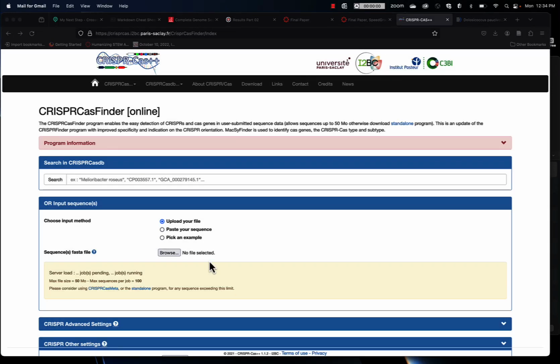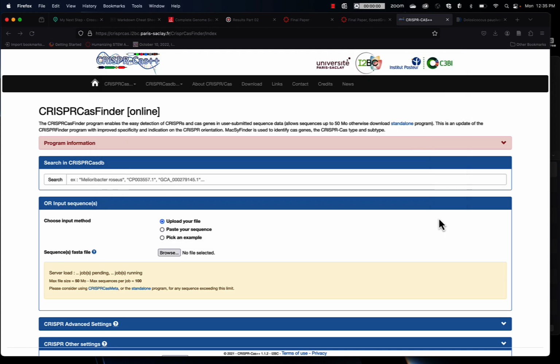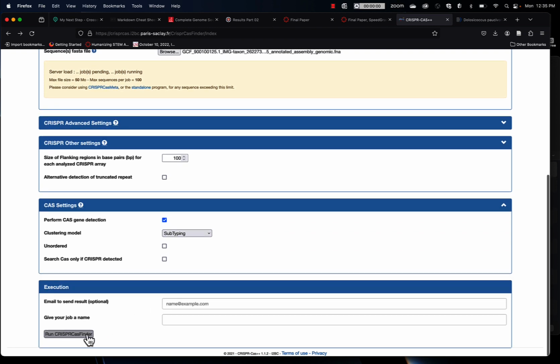One thing that can happen when you're running the CRISPRCasFinder is that if your genome has too many contigs, you'll get an error. So I'm going to show you what that looks like and how you can get around that. I'm going to go ahead and submit a genome that I know is too large, or has too many contigs, and we'll see what error we get.